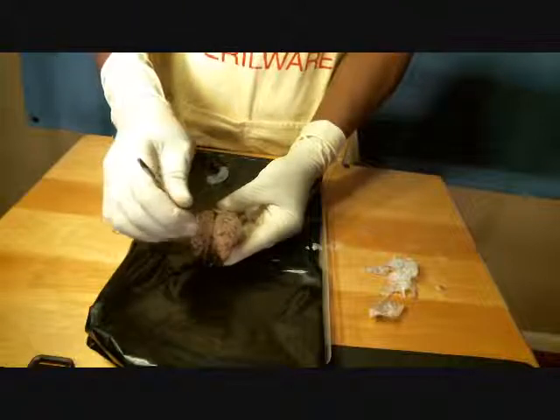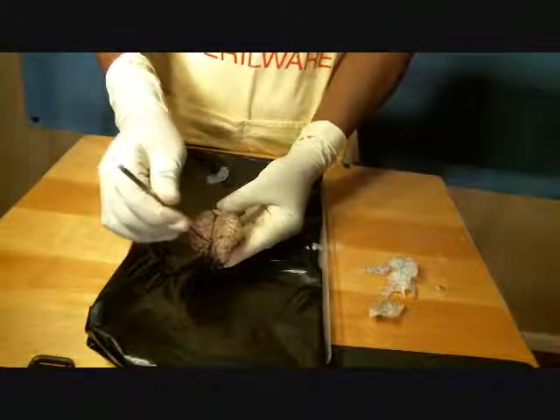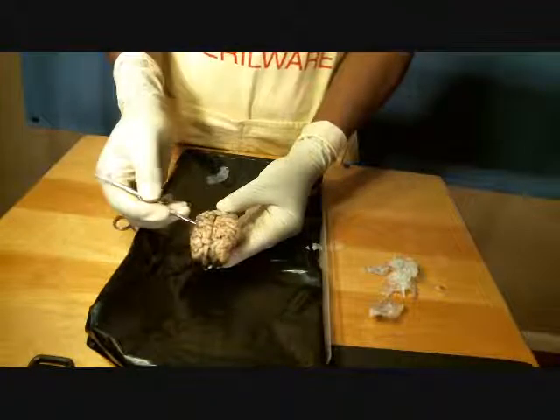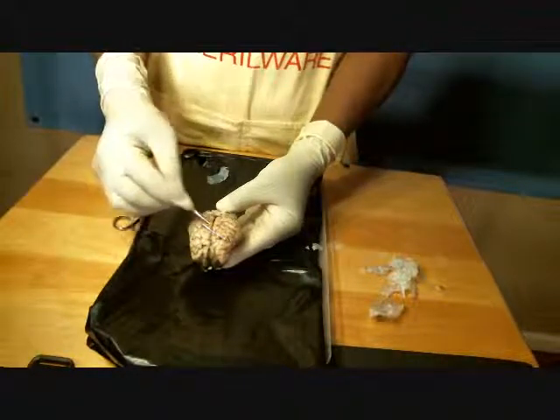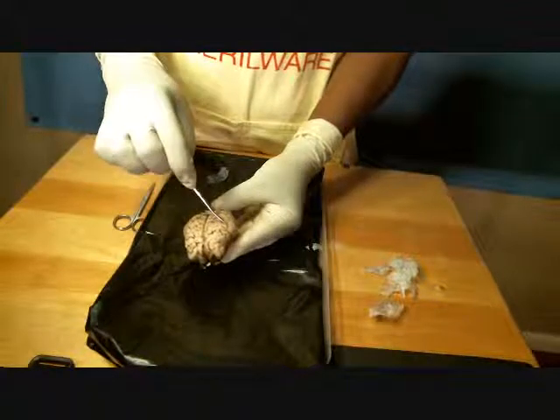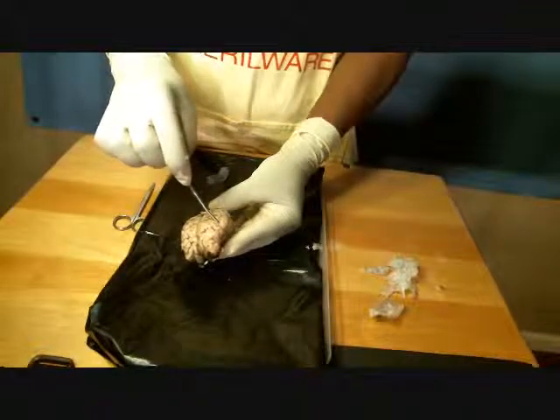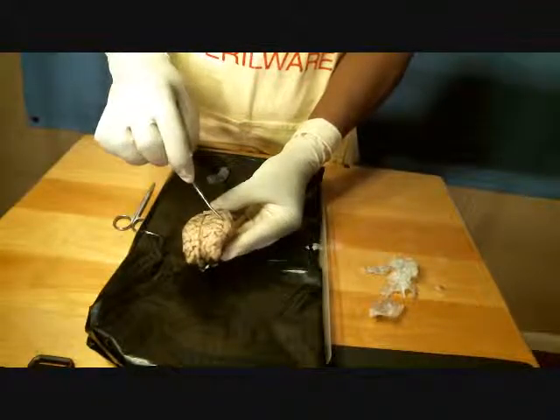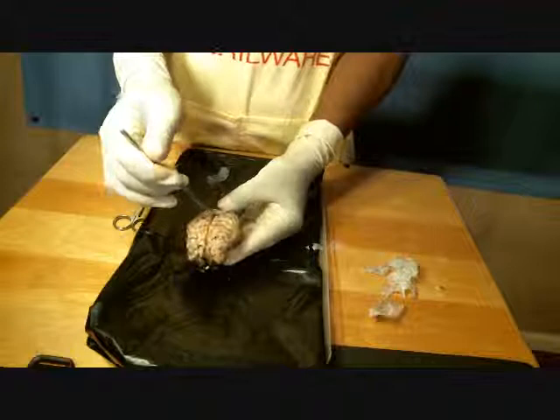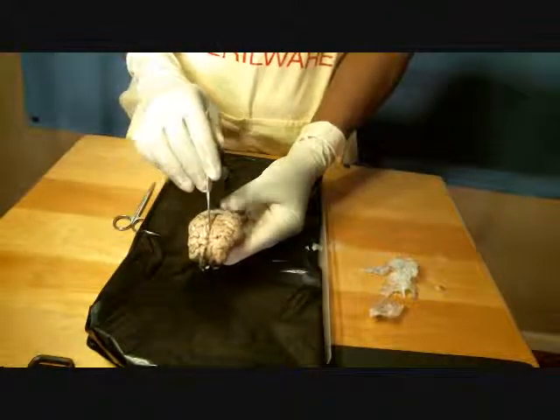Down the center, right here, we have our longitudinal fissure. We have our cracks and crevices, our gyrus, and then the sulcus, which is the actual crevice when you are able to go inside. There's a nice clear delineation for this longitudinal fissure.